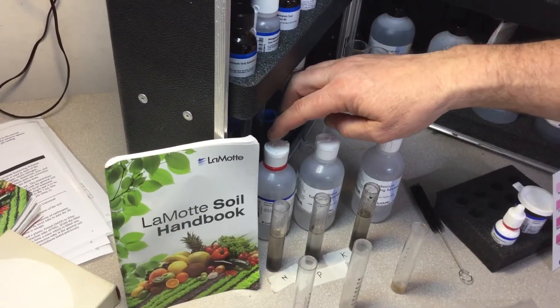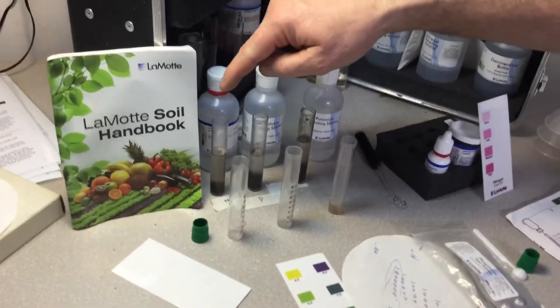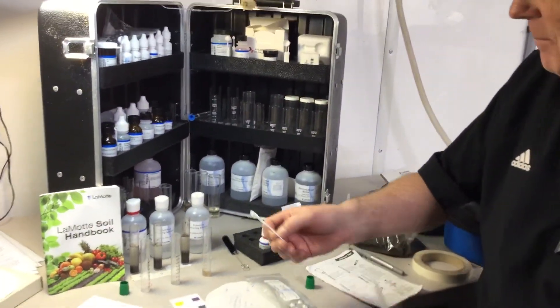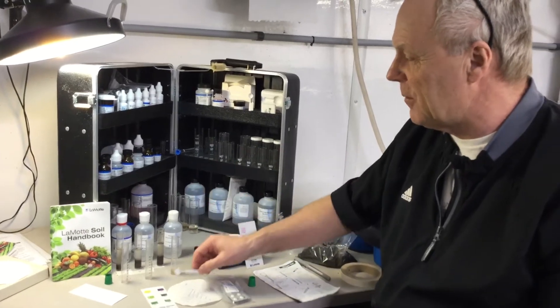It takes about to line seven on a test tube of extracting fluid. And then it takes three half scoops in both the phosphorus and the nitrogen, and then a little bit more — it takes four of them in the potassium.